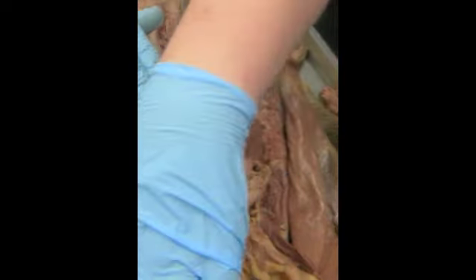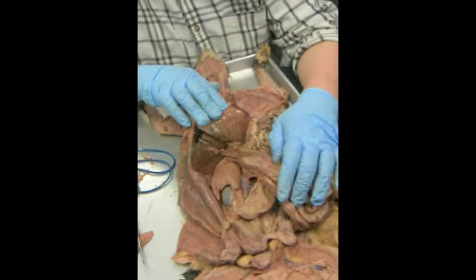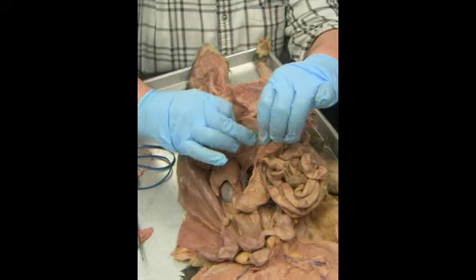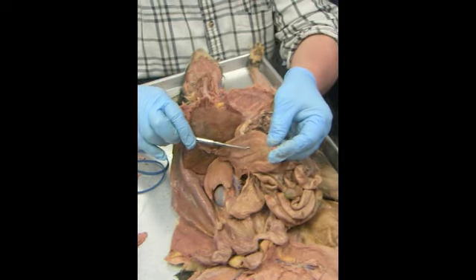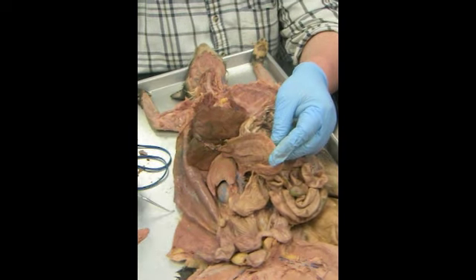Okay. We now want to find the intestines. To find the intestines, we pull this up and move everyone over to the left. Here on the left, we pull the first thing back. This is the duodenum. The duodenum has a gland right here called the pancreas. The duct of that is called the duct of Wirsung, or the pancreatic duct. That would also go in through the ampulla of Vater.